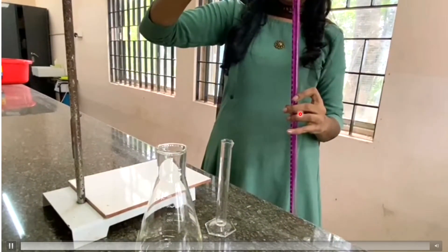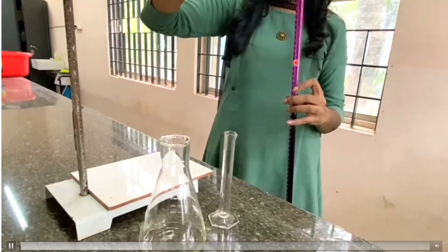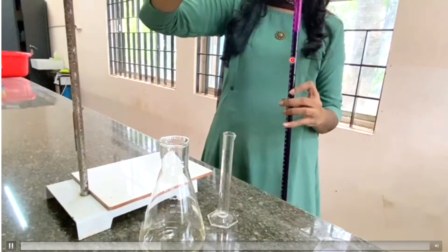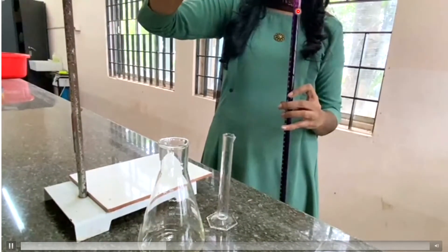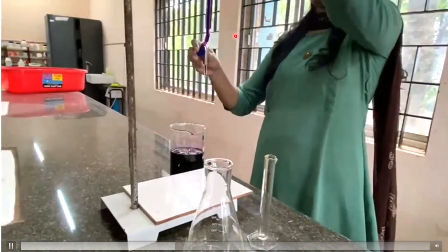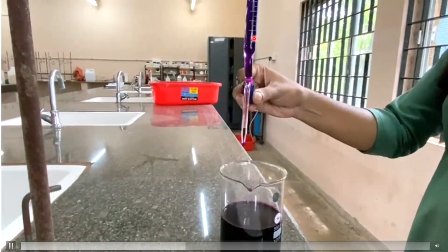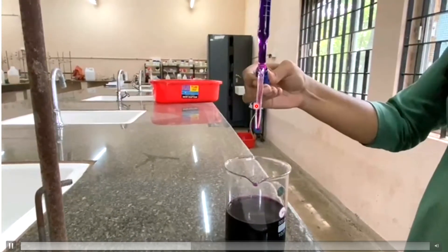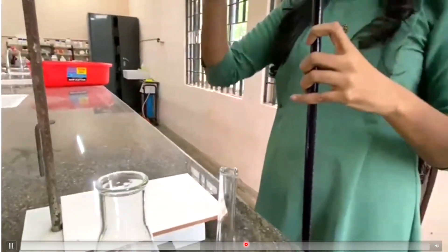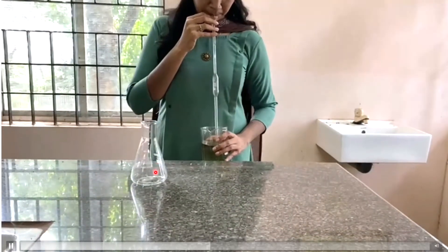In a normal colorless solution we would identify the lower meniscus, but since KMnO₄ is a colored solution, it is difficult to identify the lower meniscus. So instead we will adjust the upper meniscus to zero on the burette. In the case of a colored solution, we use the upper meniscus.